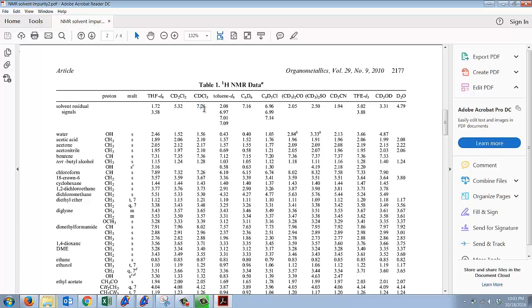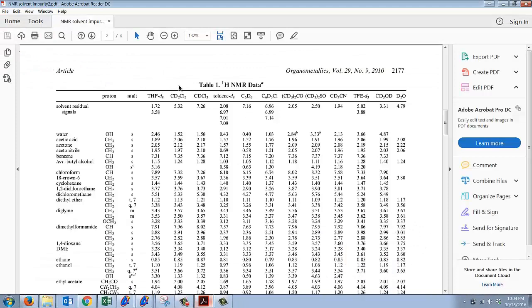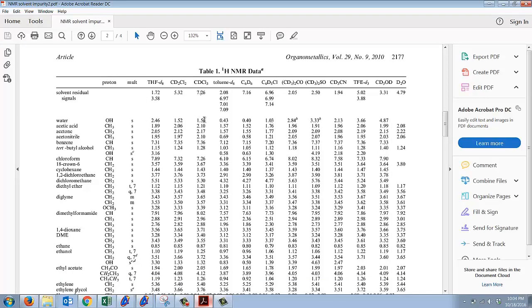For instance, chloroform D, when it has a residual peak, either because there's a little water or there was some extra CHCl3 chloroform that was left in the sample before the bottle was shipped, we have a peak at 7.26. So you're typically going to see a peak at 7.26 in a lot of your samples. It may be very little, but if you have a lot of water, you're probably going to see a lot of this peak. And if you have water, you should also see a rounded, more broad peak for the OH on water as a singlet at about 1.56 in chloroform.